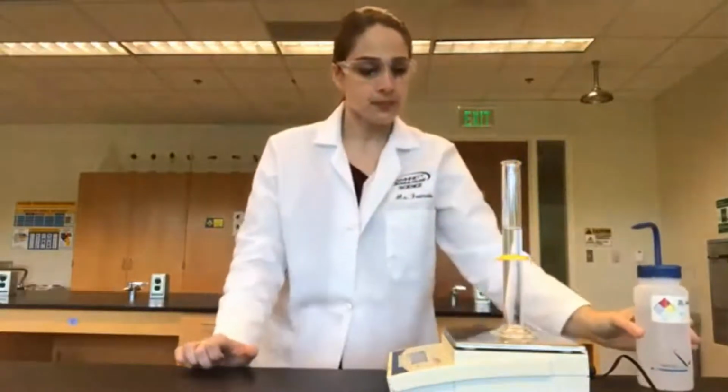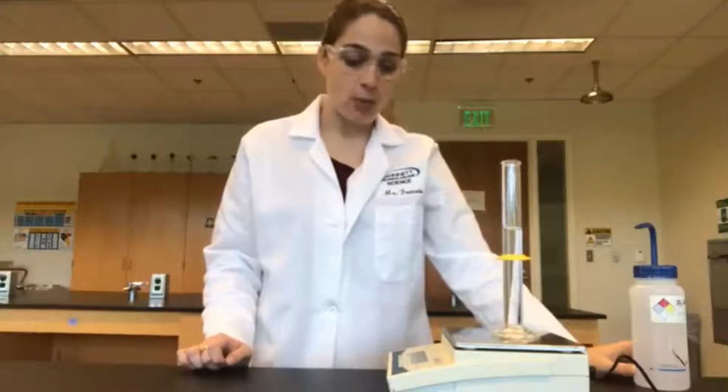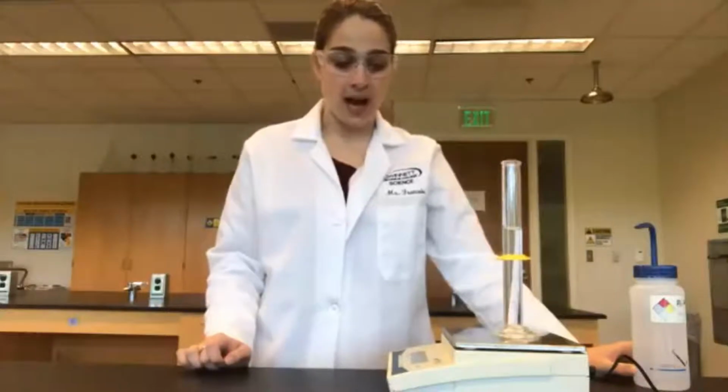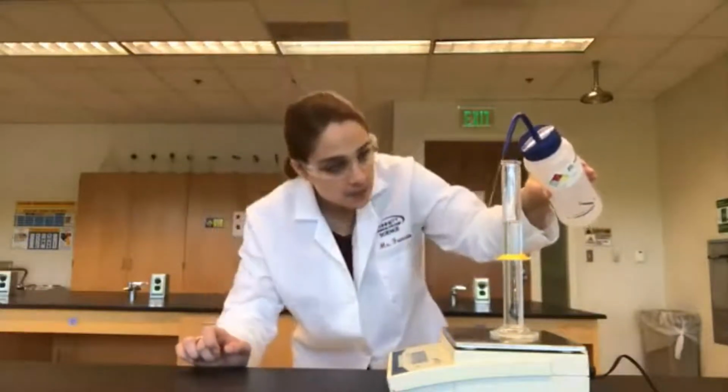Okay. And our new mass is 135.55. Now we're going to add our last 10 milliliters to take us to 50.